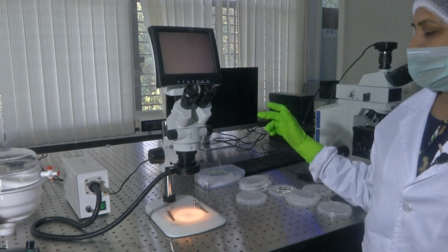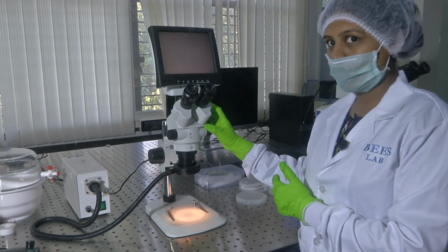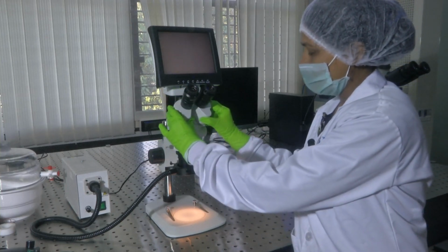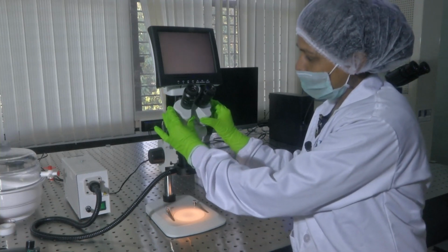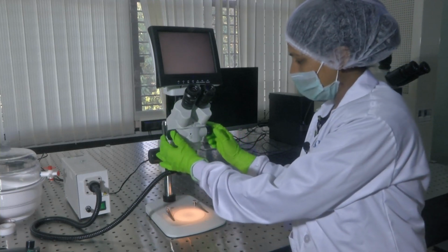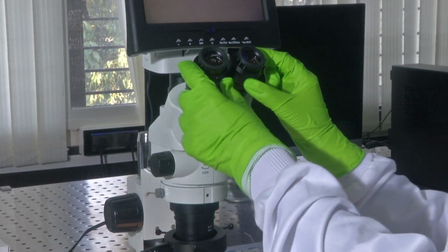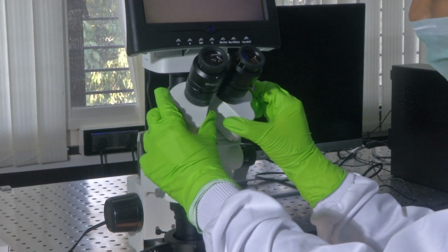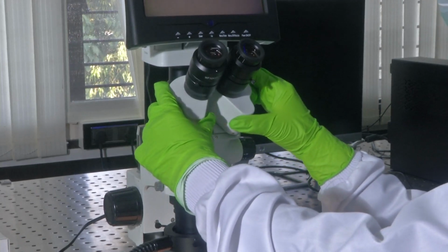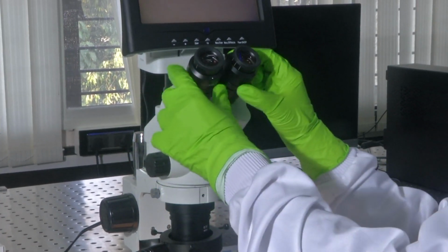Now, how do we adjust the magnification? There are different knobs provided on the microscope we have here. The eyepiece can be moved accordingly and matched so that it fits properly to your eyes, and these two knobs here are to adjust your focus. Just below the display is your eyepiece through which you can look into the sample, and there is also a facility to adjust the eyepiece so that it sits properly according to the dimensions of your eyes. This is an additional feature which comes below the eyepiece.